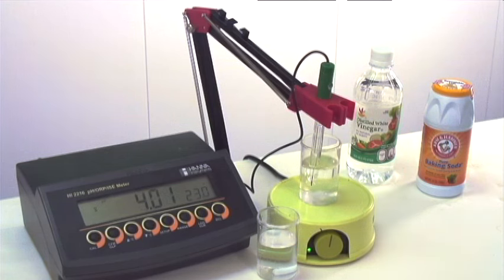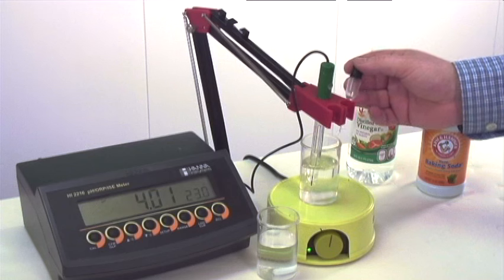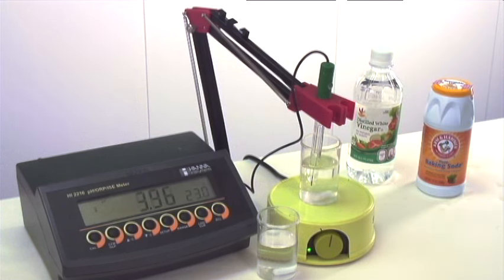The third drop drops it to around 4, and with a fourth drop, it goes below 4 pH. We're ending around 3.9.